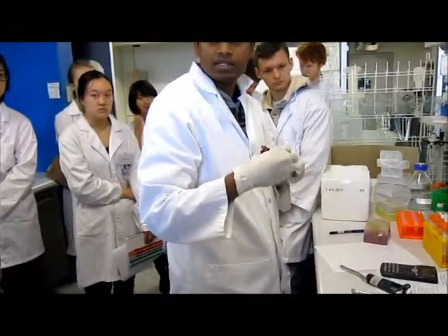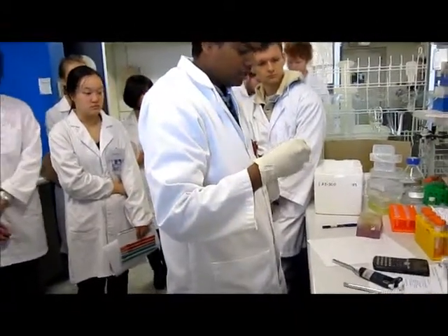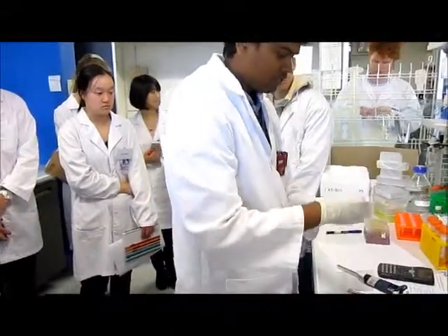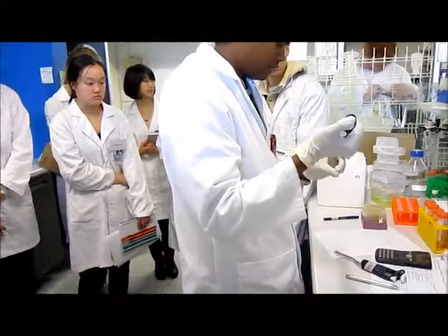Is it clear to you guys? Any confusion? At this stage, hopefully not. 5 microliter of 10 times buffer.